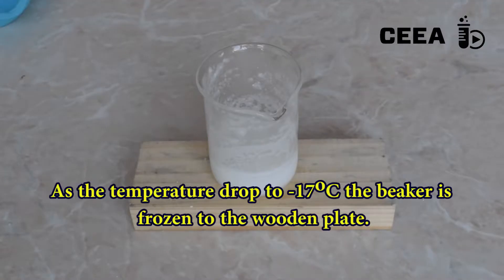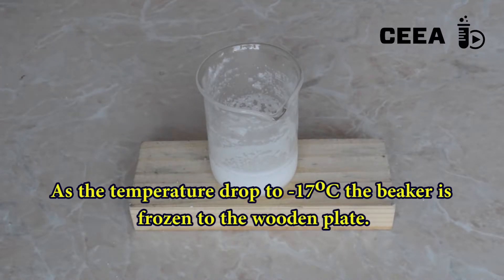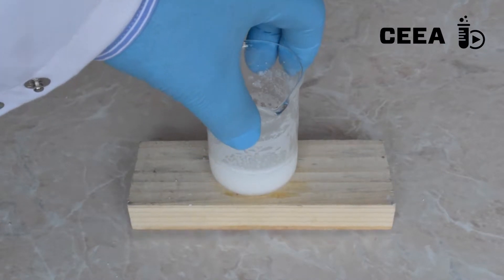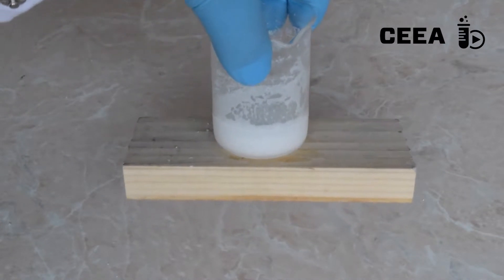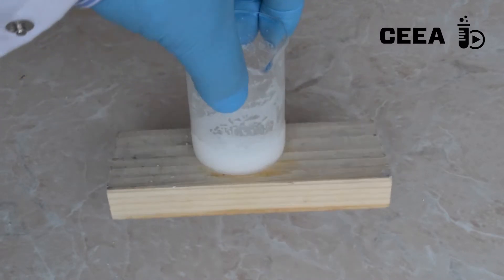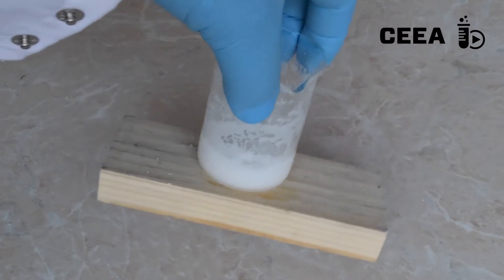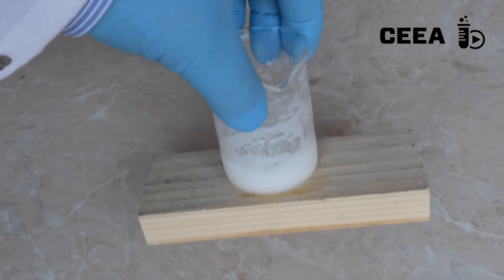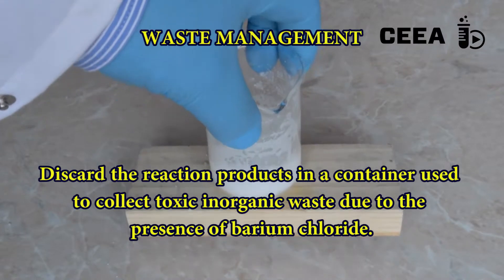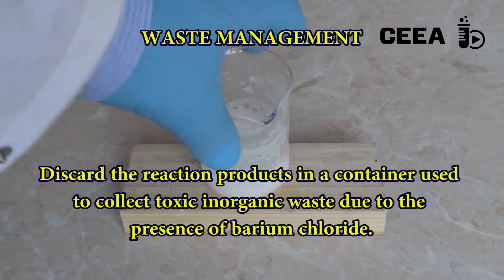Observe the beaker which is frozen to the wooden plate due to the low temperature obtained. As barium chloride is formed, discard the reaction products in a container used to collect toxic inorganic waste.